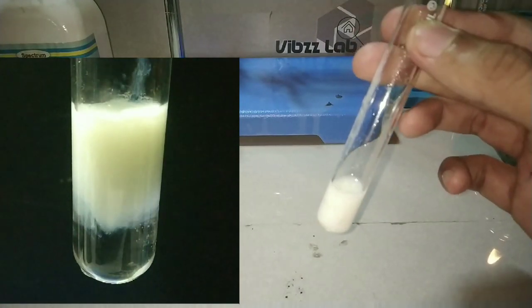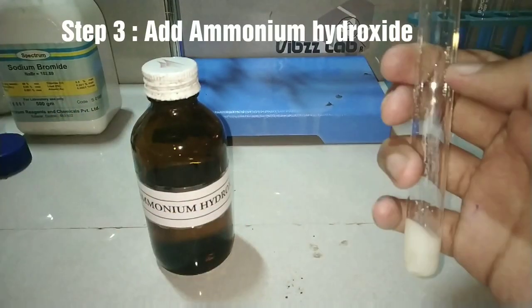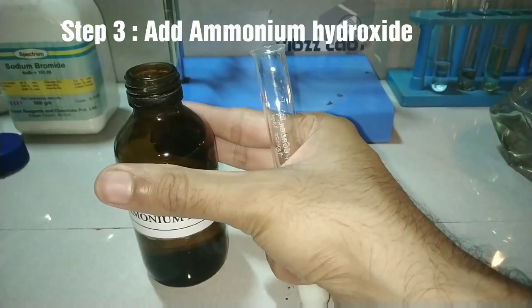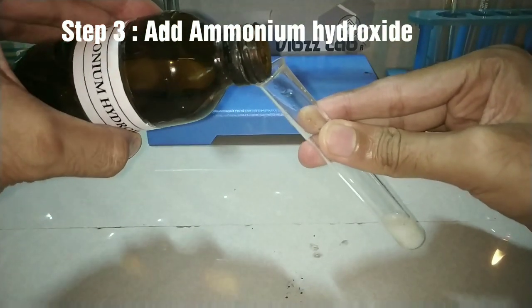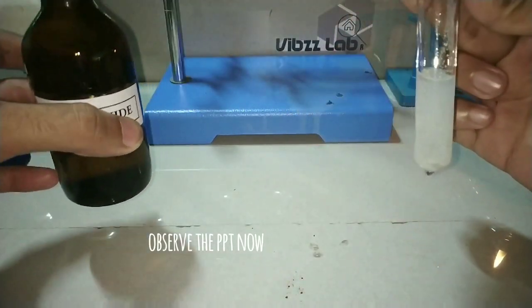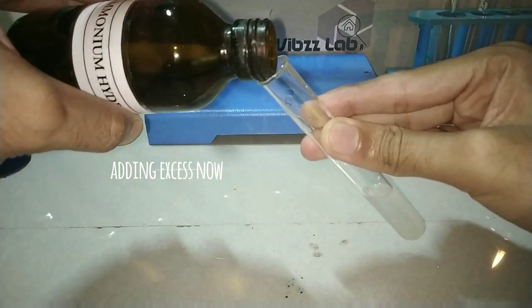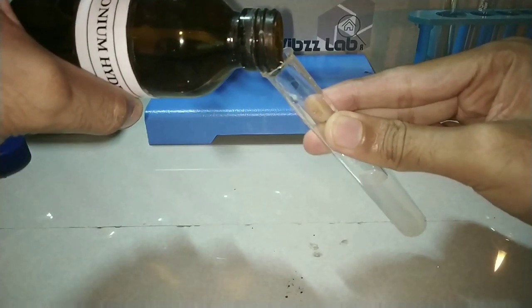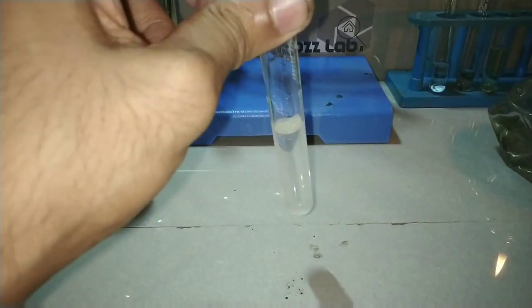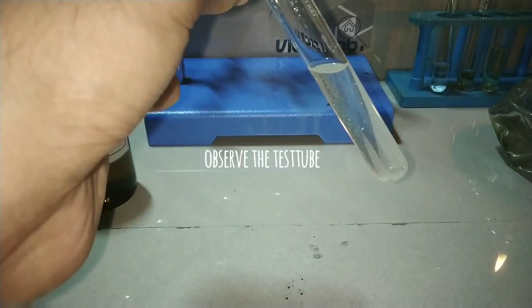As we did for the chloride ion, we will try to dissolve this precipitate in ammonium hydroxide solution. The amount of ammonium hydroxide I added initially should have dissolved the precipitate if it were a chloride ion, but it didn't. So I added more ammonium hydroxide, and you can see that the precipitate has now dissolved.